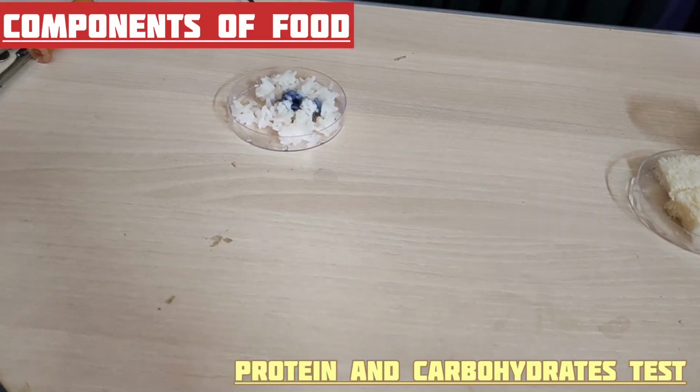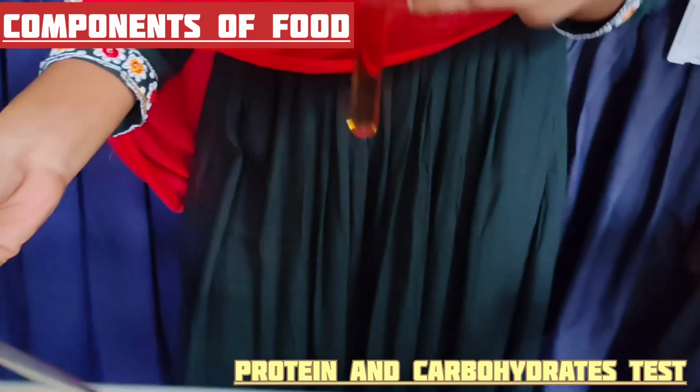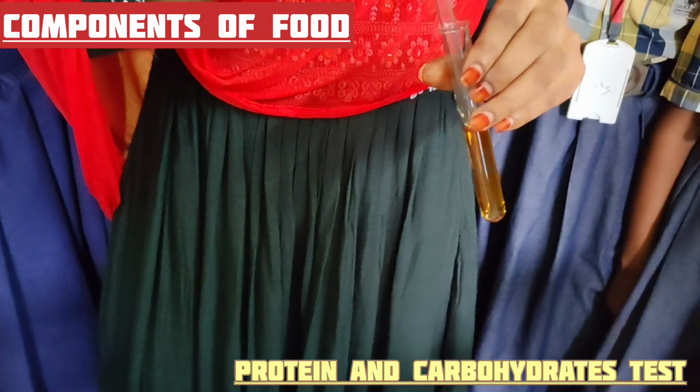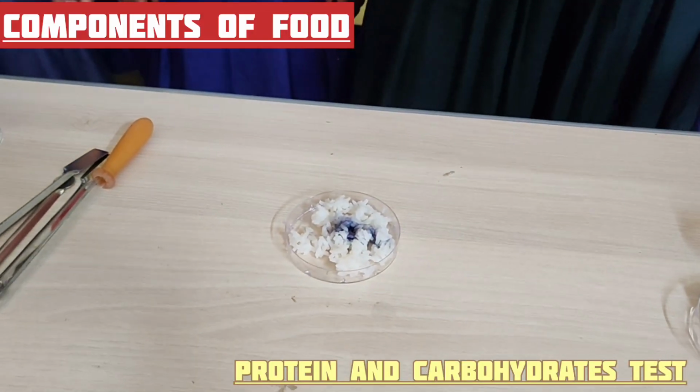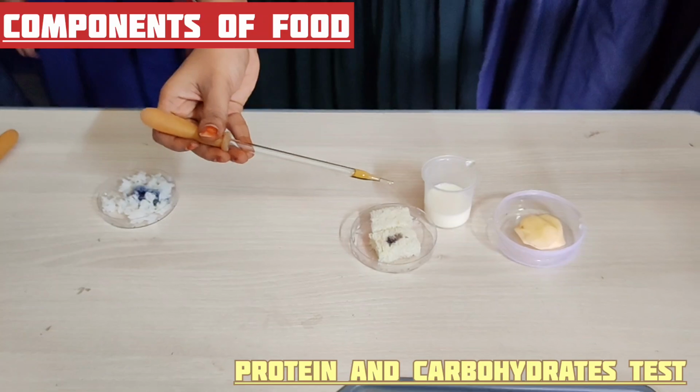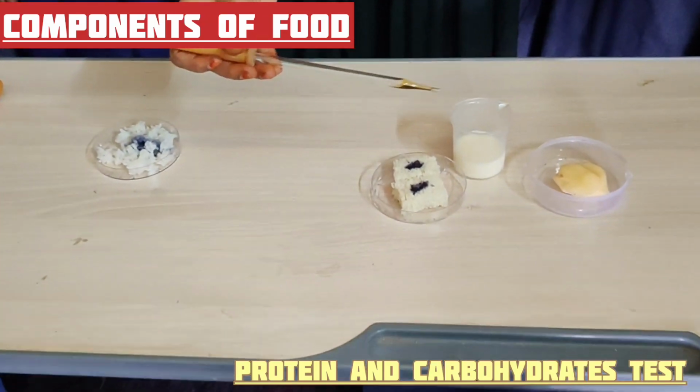Observe it. Okay. And I am taking another few drops of iodine solution and I will add these iodine solution drops into the bread. Observe this one.